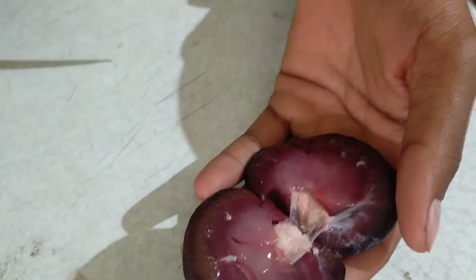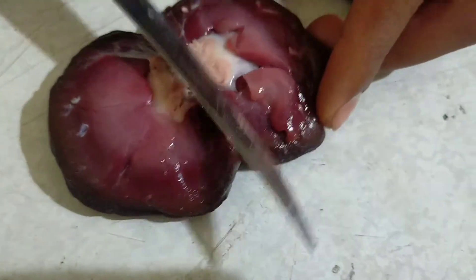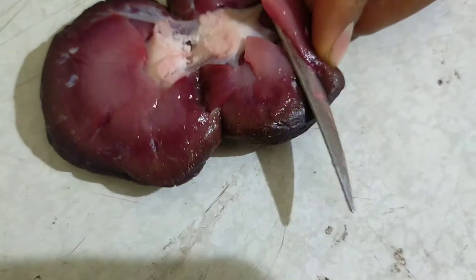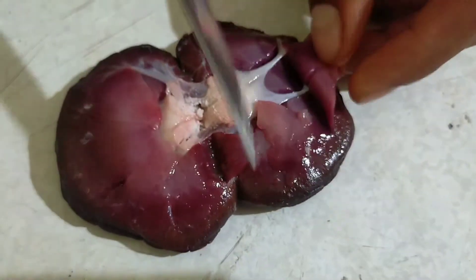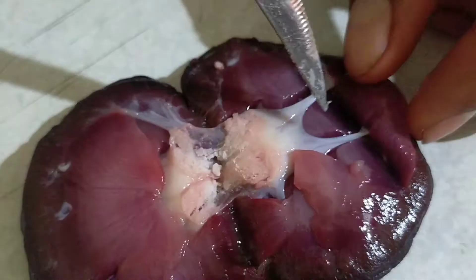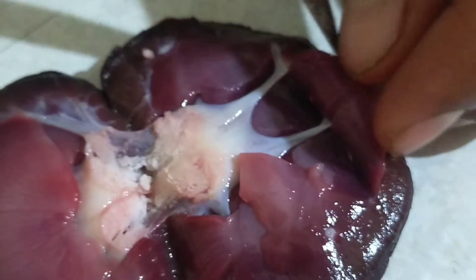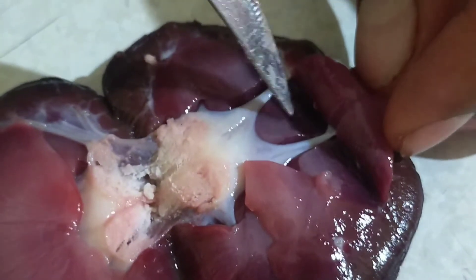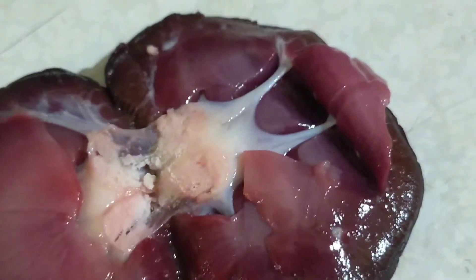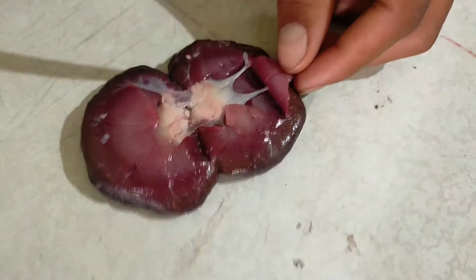I am going to cut one more. Here we can observe this U-like structure, convex like this. This is known as calyces. These are the calyces.